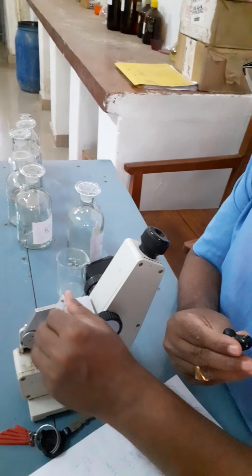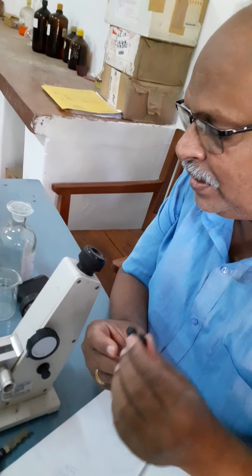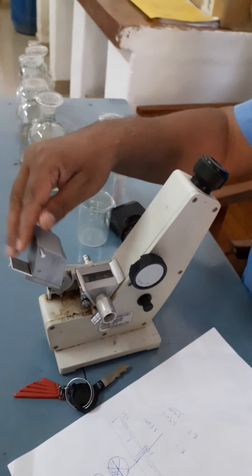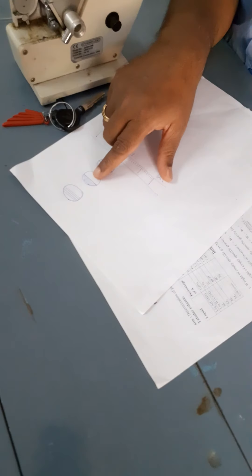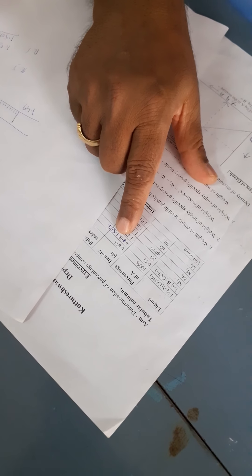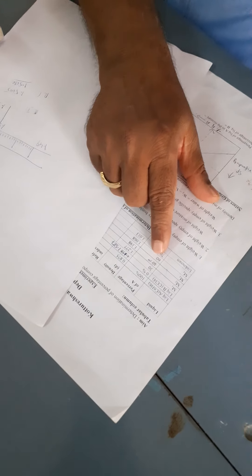After taking the reading, open the prism table again and clean it thoroughly using a dry cotton piece. Place two drops of liquid B on the prism table and close it. Repeat the same procedure — get the colored band, then the half-shadow, align the dark band with the crosswire — and record the refractive index value of liquid B. Similarly repeat the procedure to get the refractive index values of M1, M2, M3, and the unknown liquid mixture C.